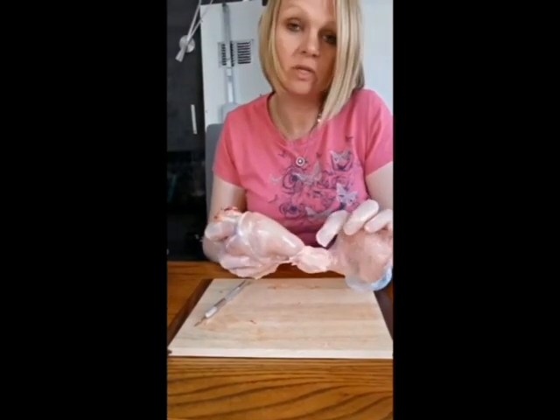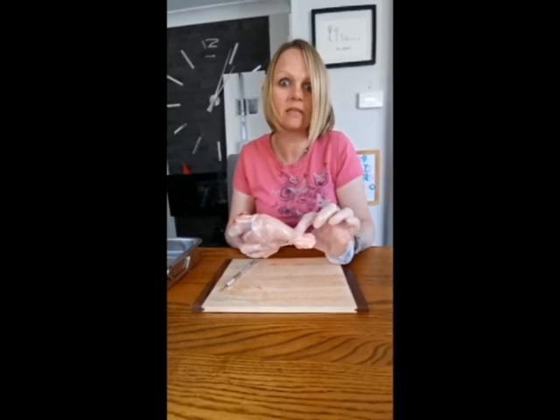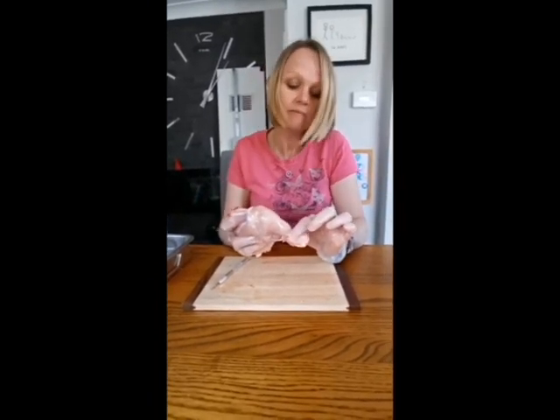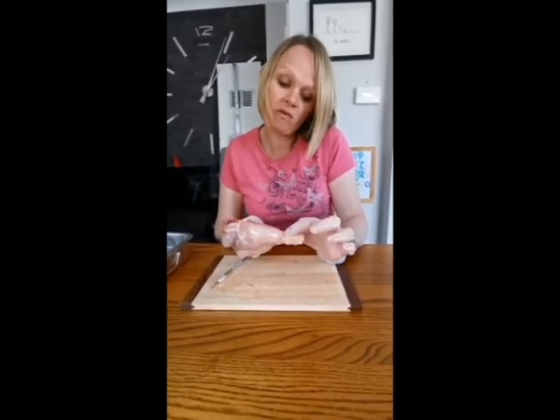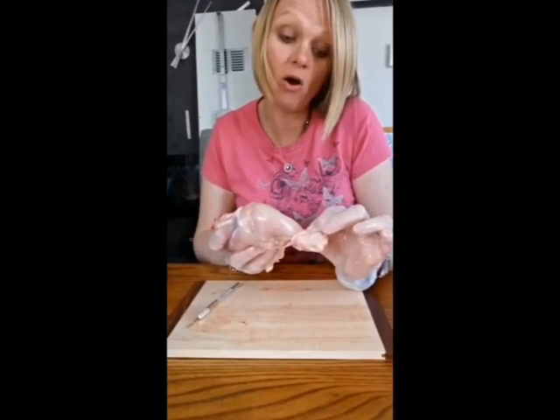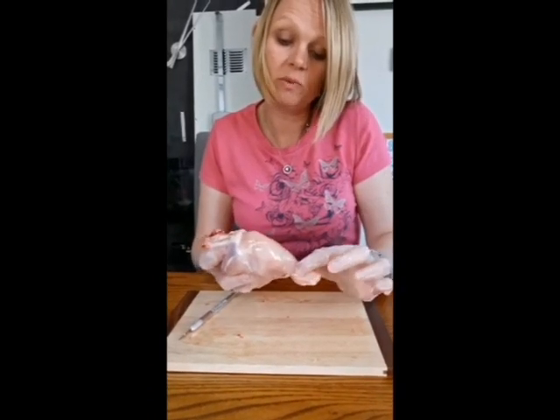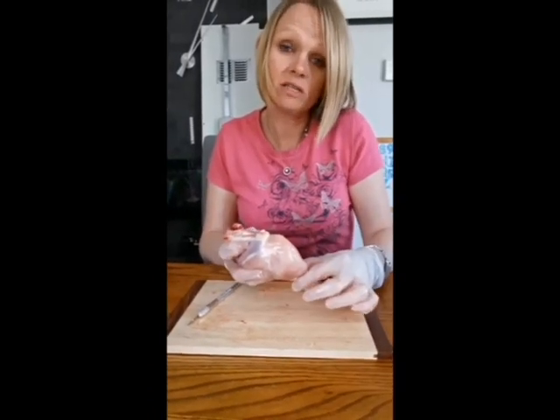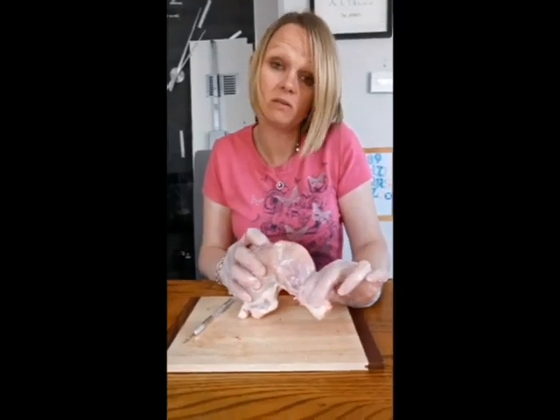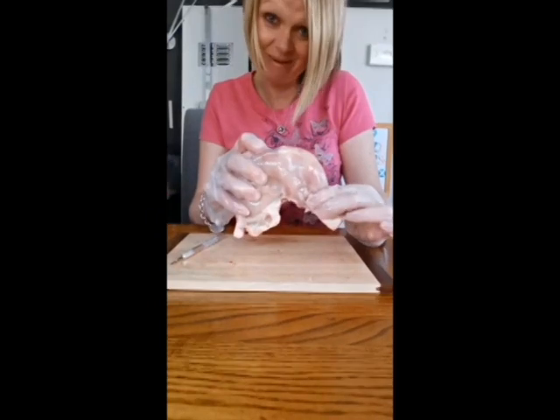We're going to look for a thing called a tendon. Now you probably noticed this before if you've eaten chicken drumsticks at KFC, sorry for the vegetarians. There's a little bit of white gristly bit down here, and that is actually the tendon. It holds the muscle to the bone. So ligaments will be in here, tendon will be down here, and hopefully we'll see the cartilage as well. So I'm just going to cut away the muscle, and then hopefully we should see those bits. Okay, see you in a minute.